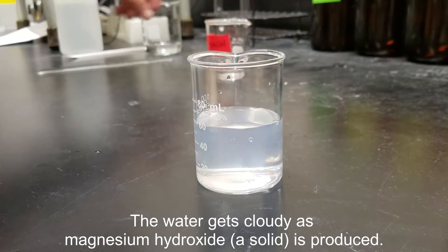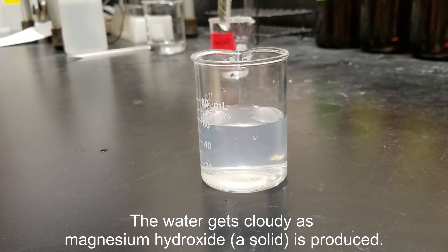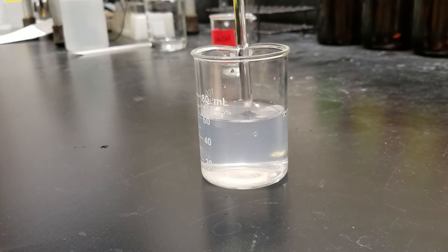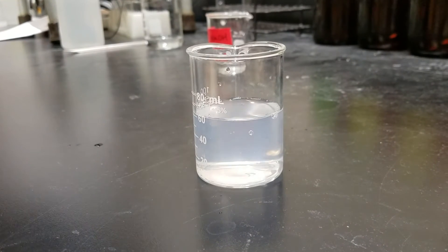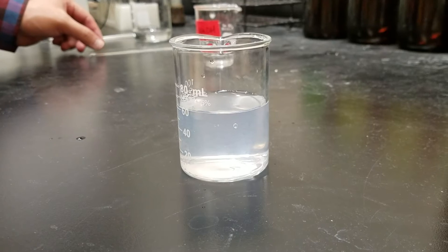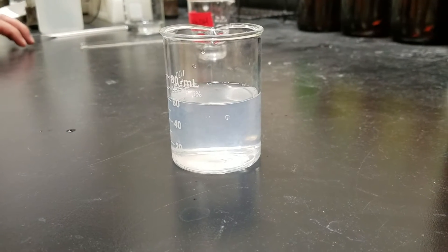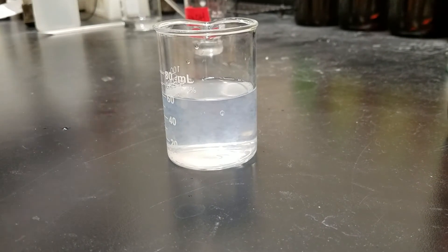Take a look at that water. It's cloudy. Try to think why that is. That's tiny flecks of precipitate, the new compound that we created, floating around in the water.